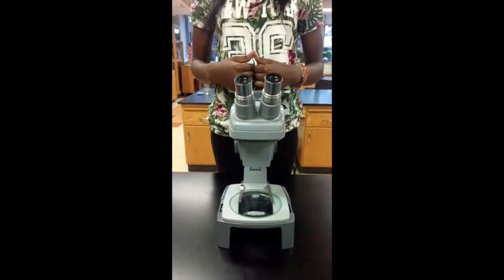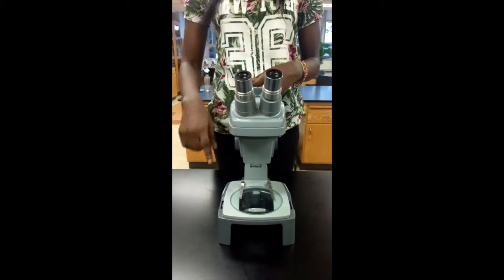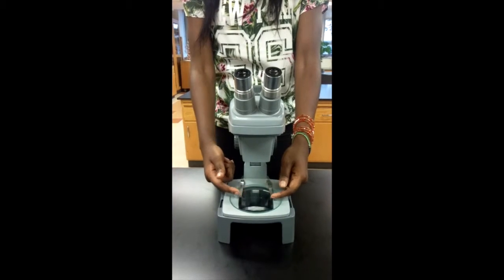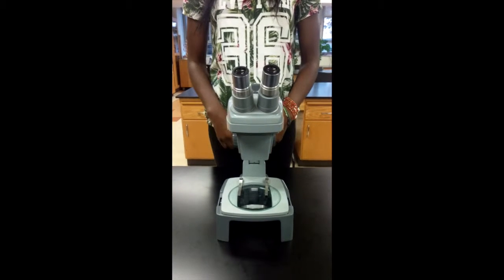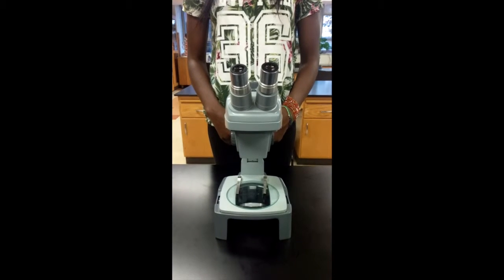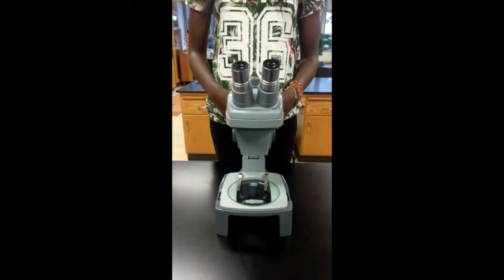The dissecting and the compound are very similar, but here are some differences. Rather than the whole entire stage, the dissecting has a stage plate on top of the base, which is completed with stage clips. As you can see, there's no light source. You would need to use an external one. In order to control the focus with this microscope, there is only one knob, which is called the focus control. With this microscope, there is only one objective, and in order to adjust the zoom, you use the zoom control knob.